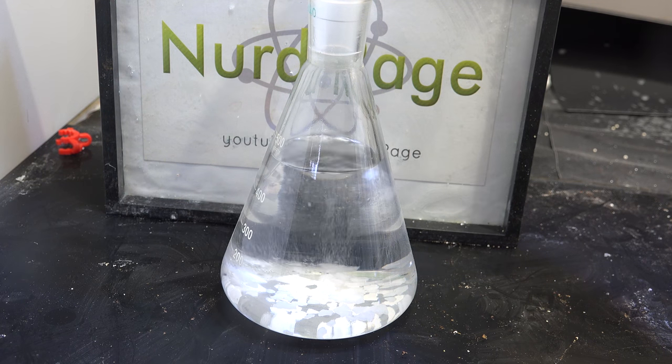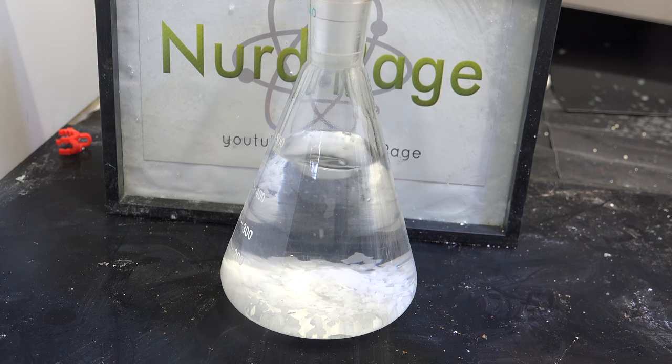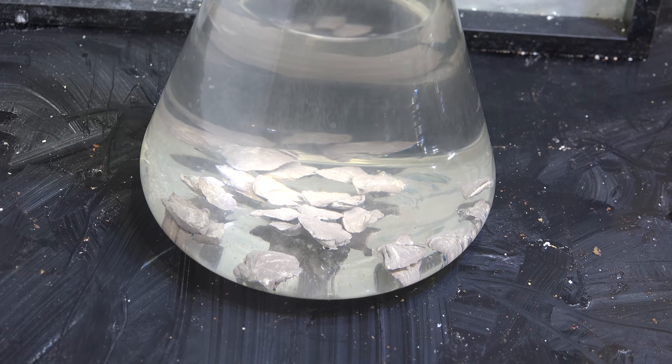You might be wondering why I didn't add sodium the first time around and went with potassium hydroxide at the beginning — two reasons. One is cost: potassium hydroxide is cheaper than sodium metal, and for an amateur chemist, using less sodium is always preferable. The second and bigger reason is safety. This was a lot of water — if it had reacted directly with the sodium then it would likely have exploded. Ether is extremely flammable and igniting it with a sodium explosion would have likely started a fireball of burning ether. In the past there have been cases of scientists being killed after being engulfed by fireballs of burning ether. So to avoid that, I removed most of the water first with potassium hydroxide before going on to using sodium to finish it off.